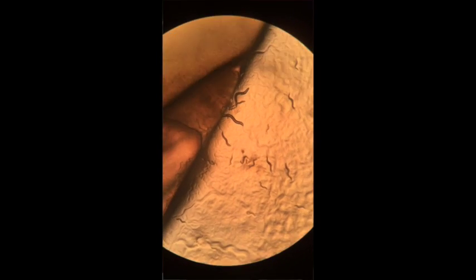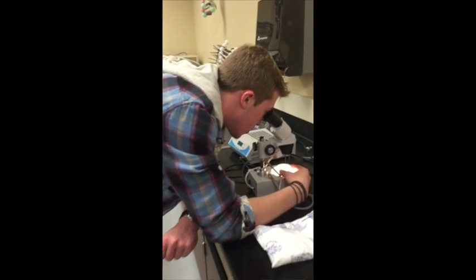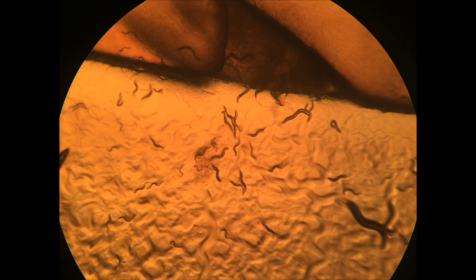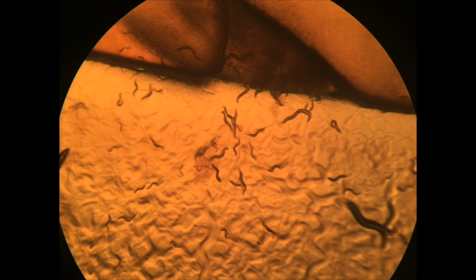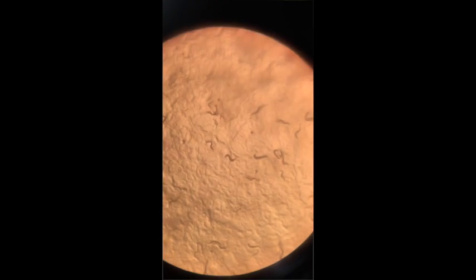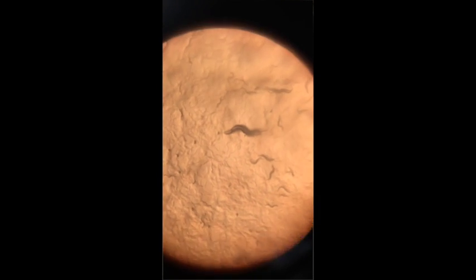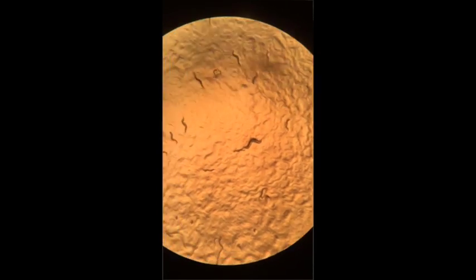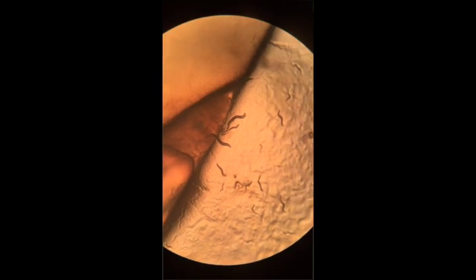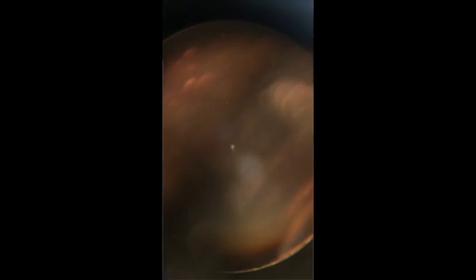We began our lab by studying the appearance, behavior, and morphology of our C. elegans. We first noticed that the wild-type worms had dark bodies and moved in a wave-like motion, almost like zigzags. Occasionally, the C. elegans would curl up into a circle, and it was not uncommon to see many clumped together in a big pile. The L1 worms seemed very small and string-like — almost hard to see. The L2s got a bit thicker and longer, yet still pretty small. The L3s had substantial size but were still thin. The L4s got thicker and seemed darker, but the adults were very thick and much bigger than the others.